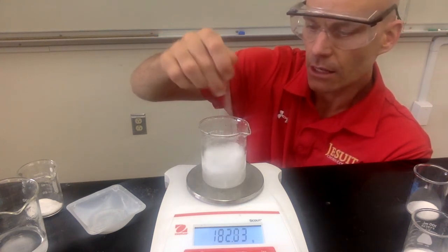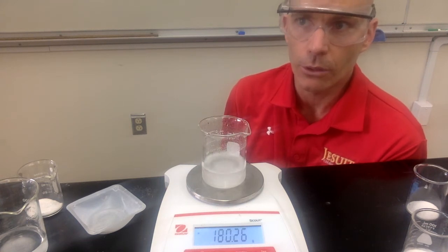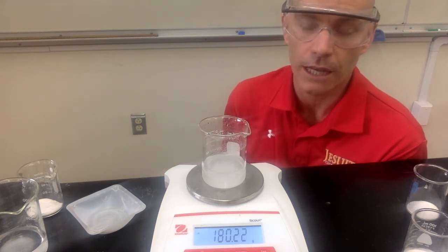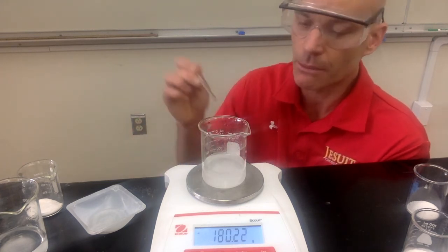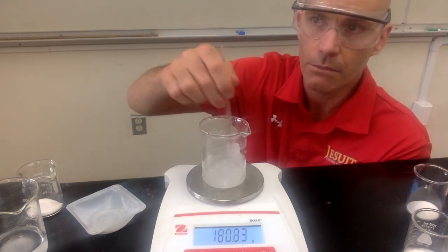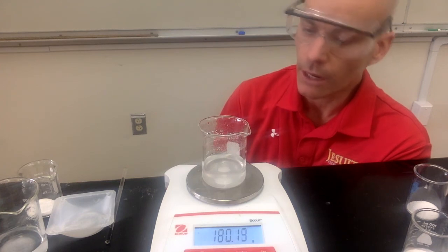And so when you're calculating, you need to do the calculations for the pure sodium bicarbonate first and figure out, if it was pure sodium bicarbonate, how much carbon dioxide does it produce per gram, or what percentage of its mass turns into carbon dioxide. And then you can use that information, based on how much carbon dioxide was produced in this mixture, to figure out how much of the mixture was sodium bicarbonate, and then the rest of it must have been sodium chloride.